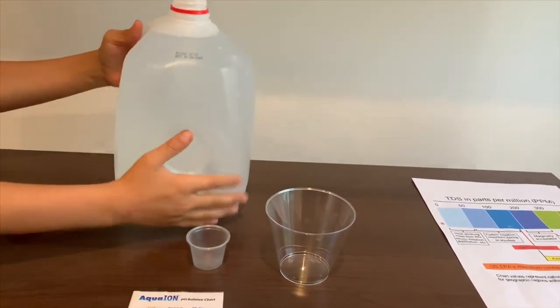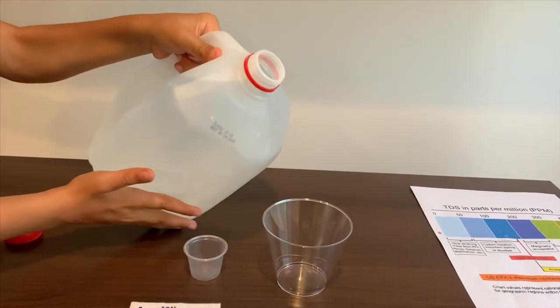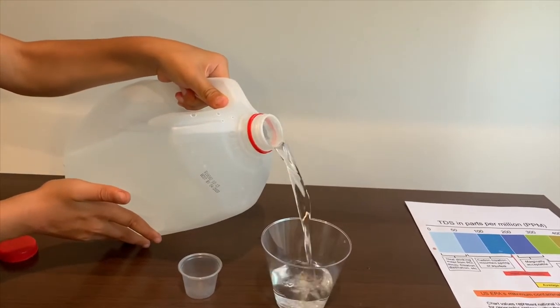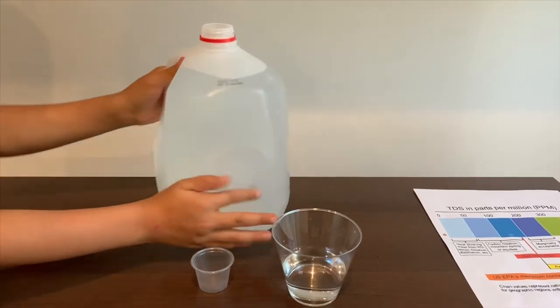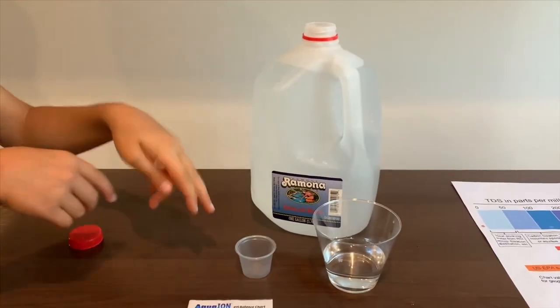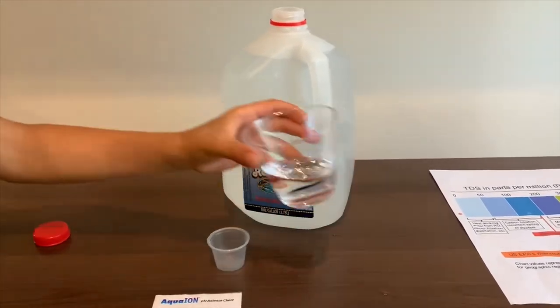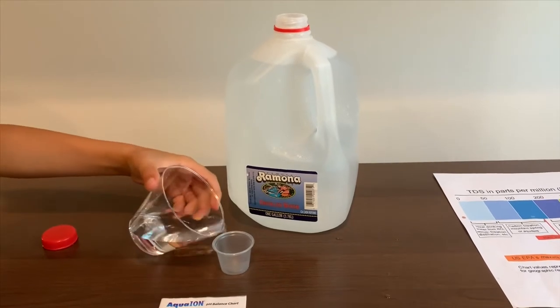Let's pour some water in. Since this bottle is too big to pour in the pH cup, I'm going to use the TDS cup to pour in the pH cup.